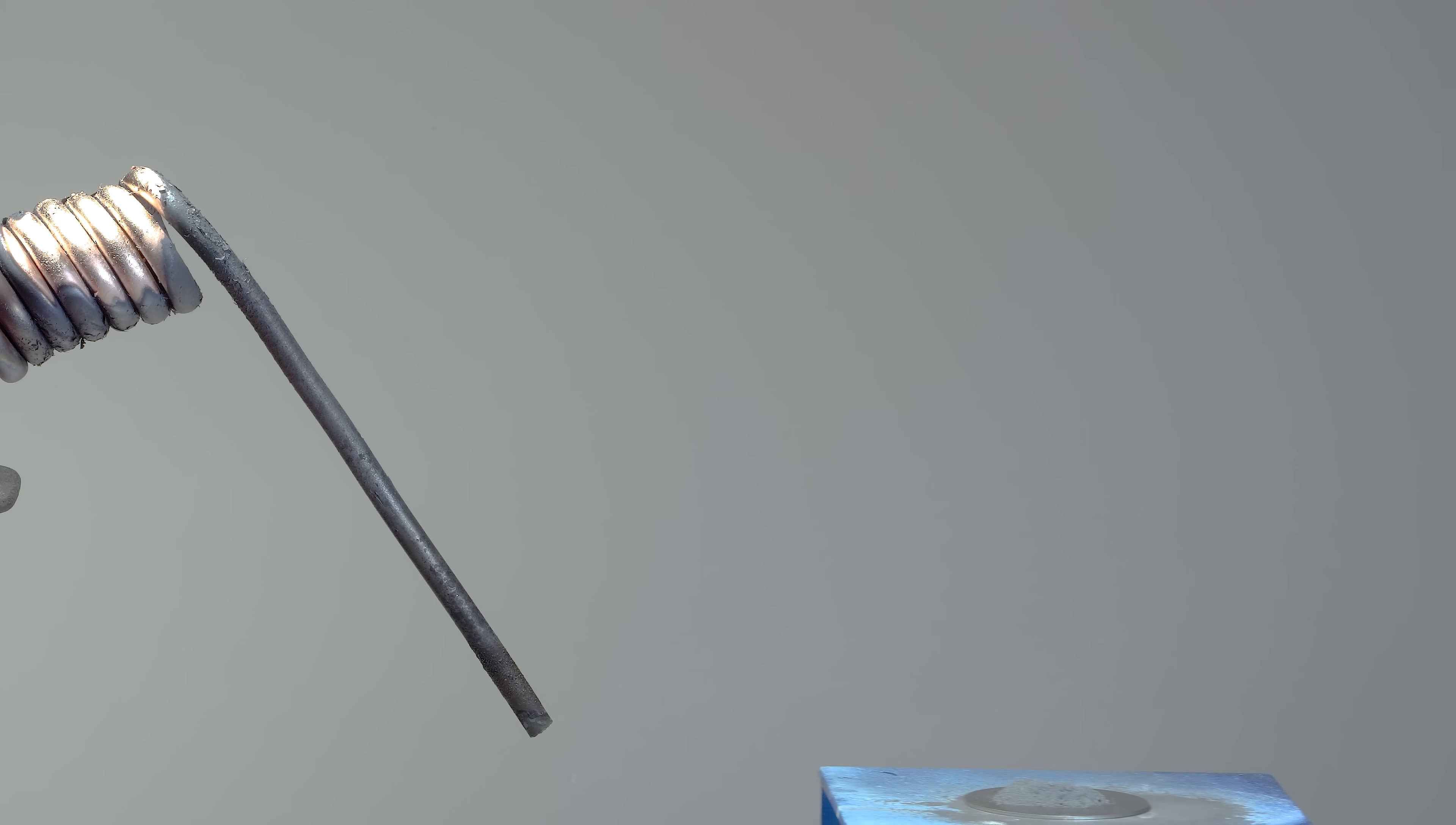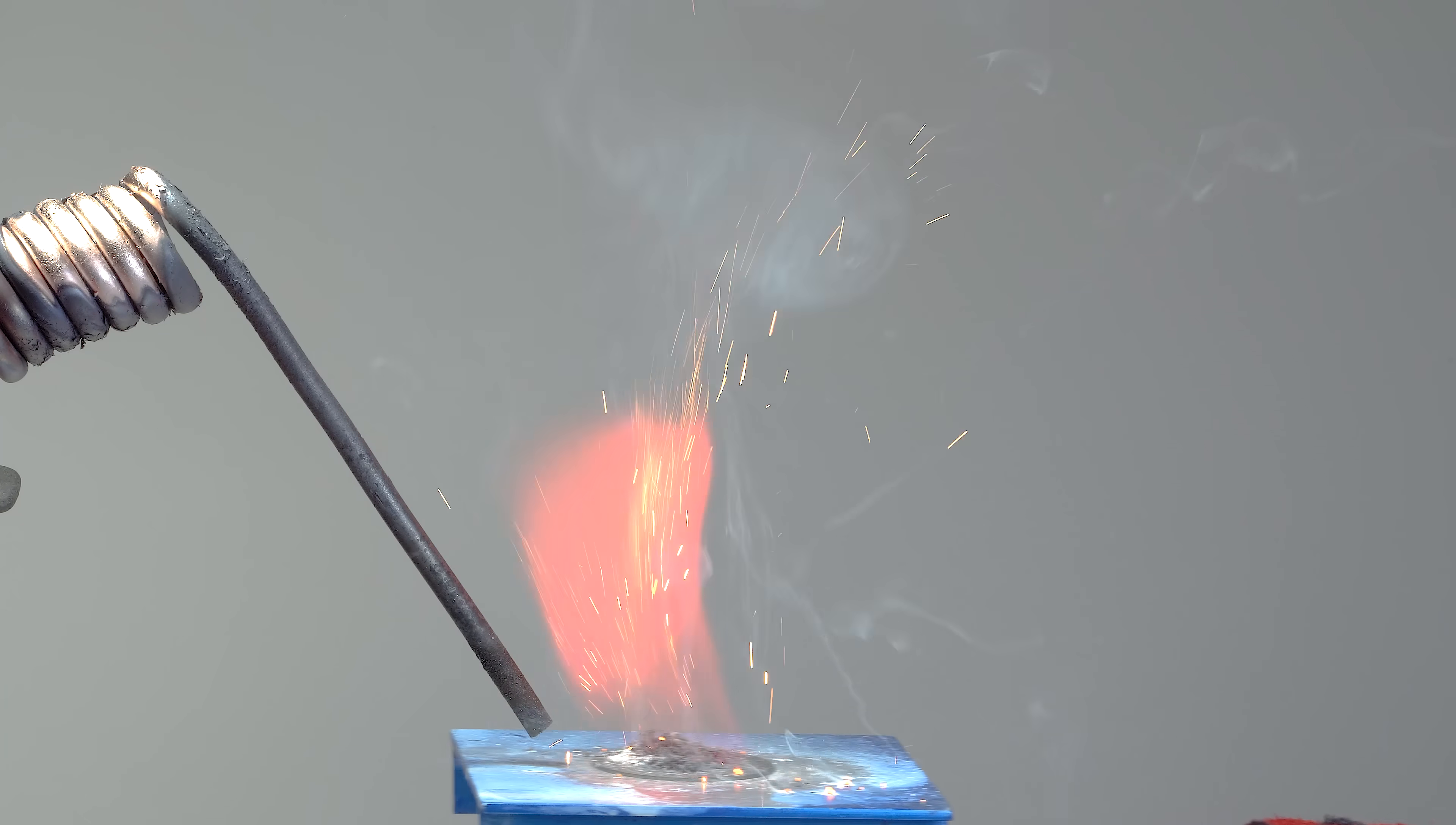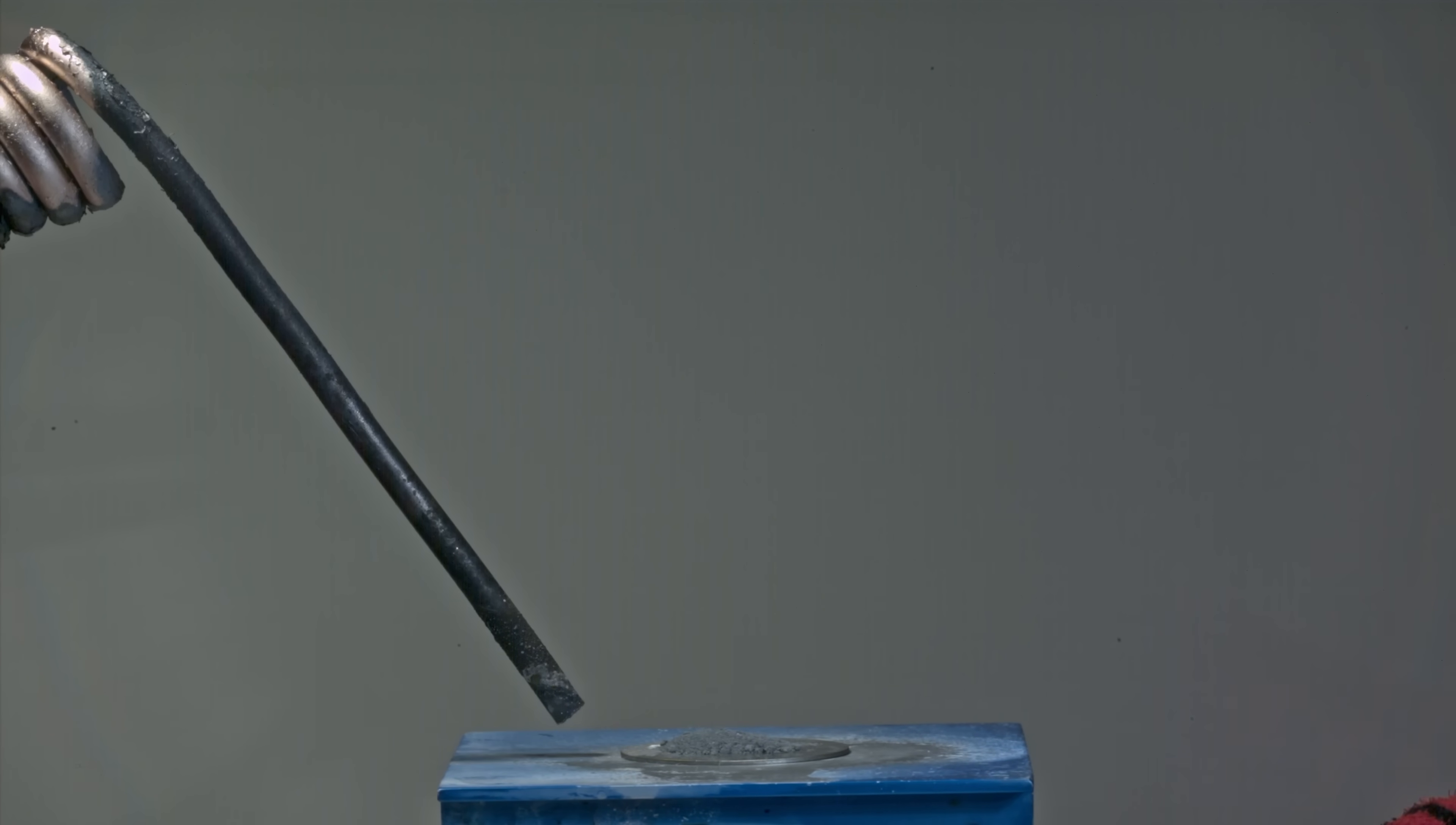In this experiment, I introduced lithium-aluminum hydride to the superheated steam, in the hopes of capturing stunning footage and extending the video's length slightly.